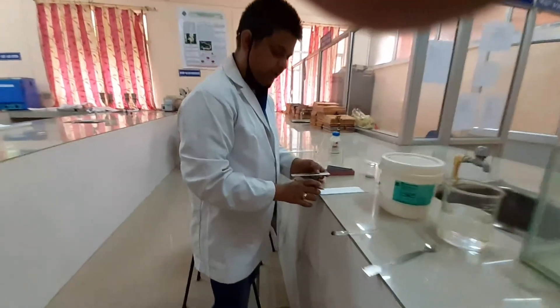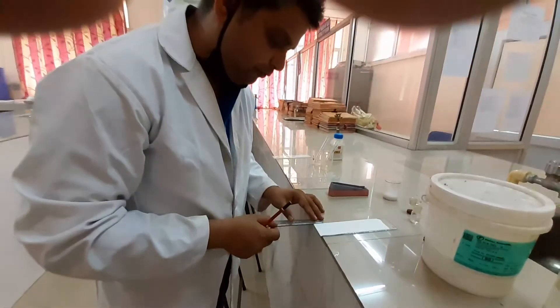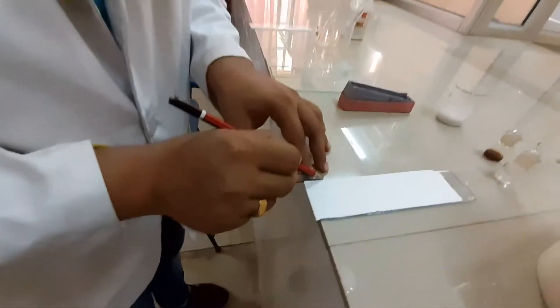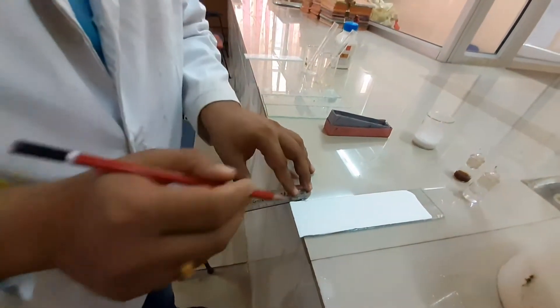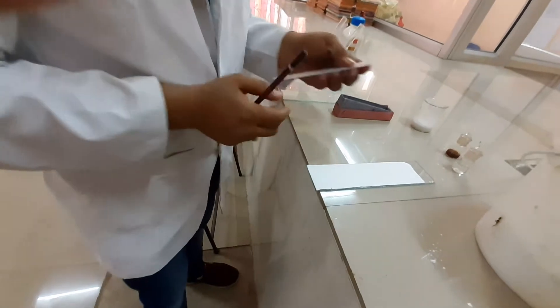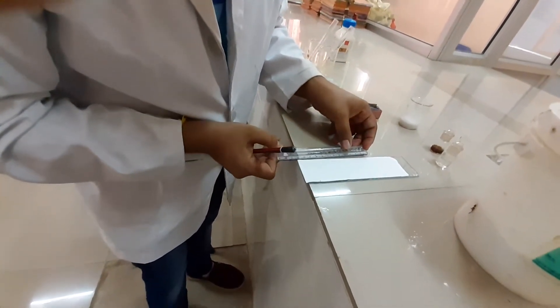This is the ready-made TLC plate available now. The first step is to measure at least 1.5 to 2 centimetres from the bottom. In this case, we have measured 2 centimetres. Be very careful — you should not scratch the TLC plate. Just mark it here, and from that mark, measure 10 centimetres upward.